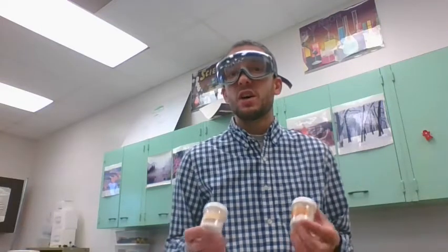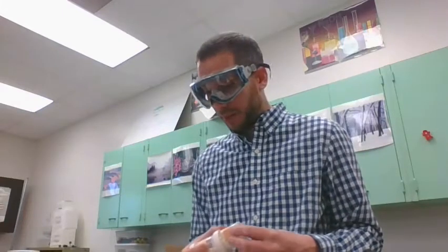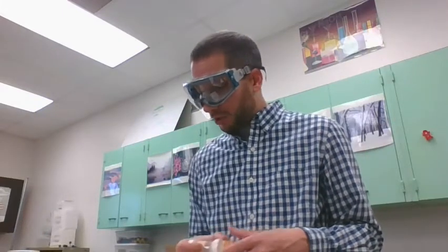We're going to dissolve them in water, and they're both going to be clear liquids. When we combine them, we'll see what happens, but we're not going to be able to tell by making an observation which one is limiting or not. So we're going to have to do the calculation portion to do that. On this one too, it's going to take another day to finish it out.